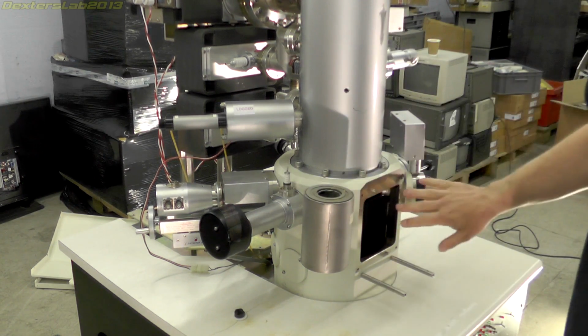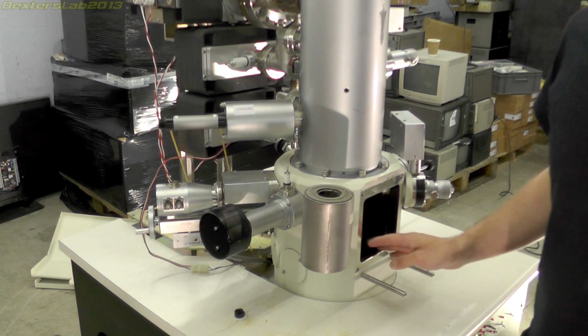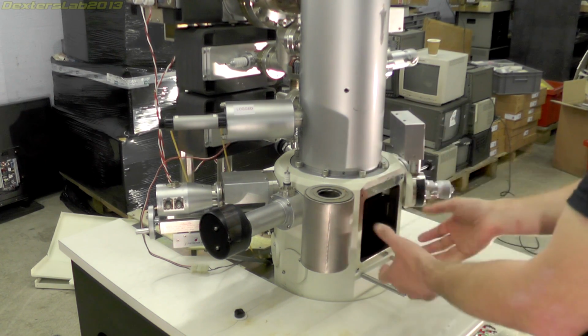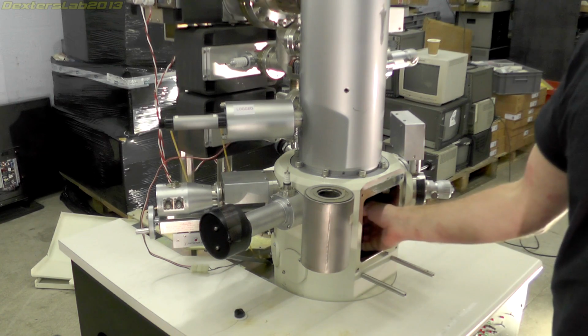The next part down is the sample chamber. This is where the specimen is placed on a multi-axis table that fits in the front of this opening. It is missing and it would have a number of hand controls on to allow you to rotate and move the sample around inside the chamber.